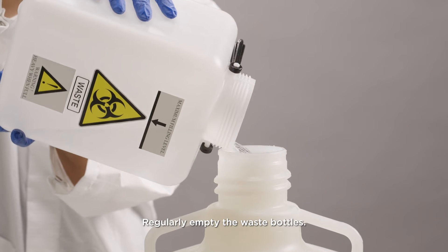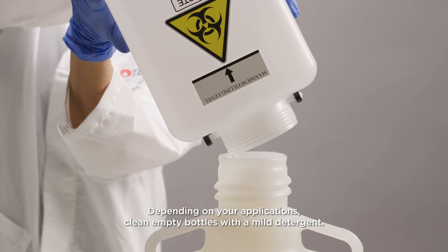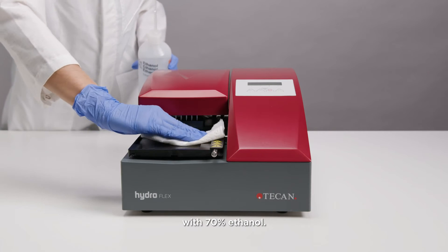Regularly empty the waste bottles. Depending on your applications, clean emptied bottles with a mild detergent. If needed, clean the plate carrier and guide bar with 70% ethanol.